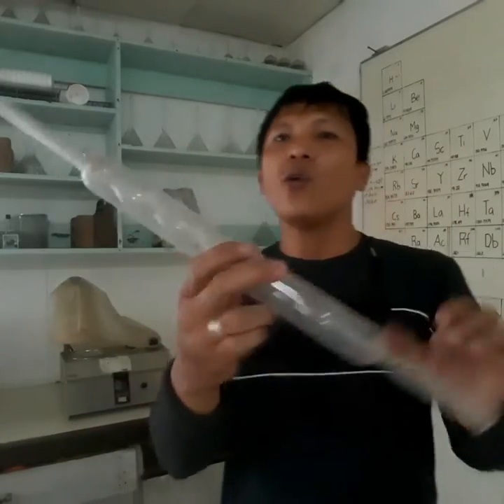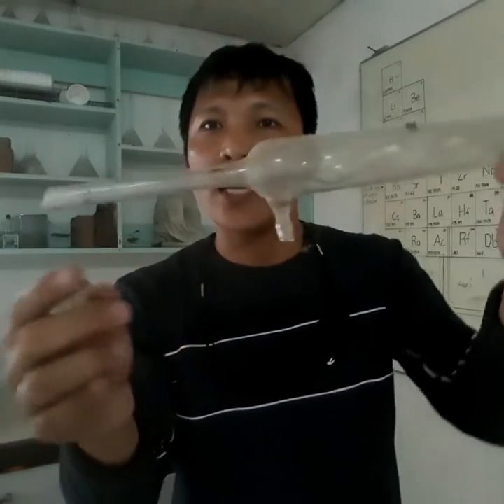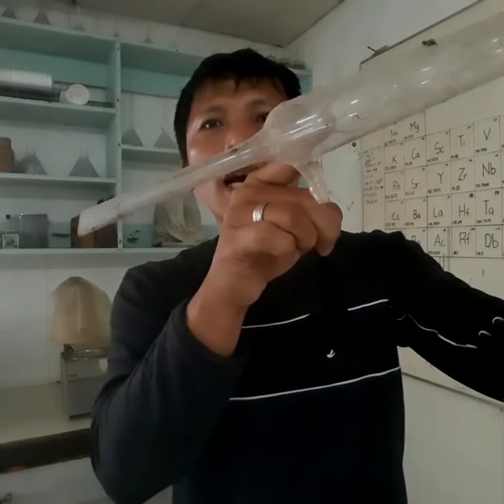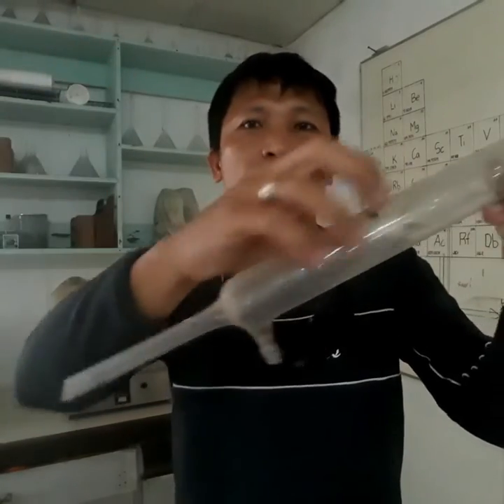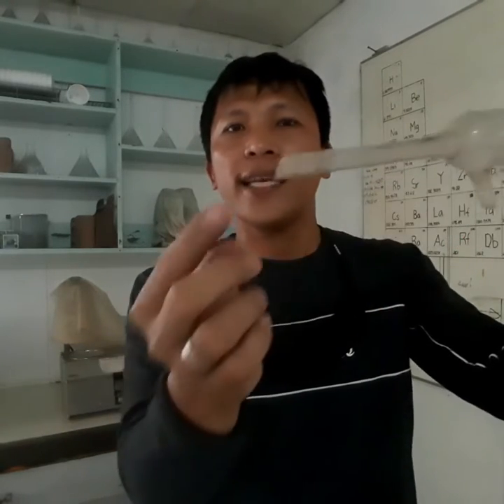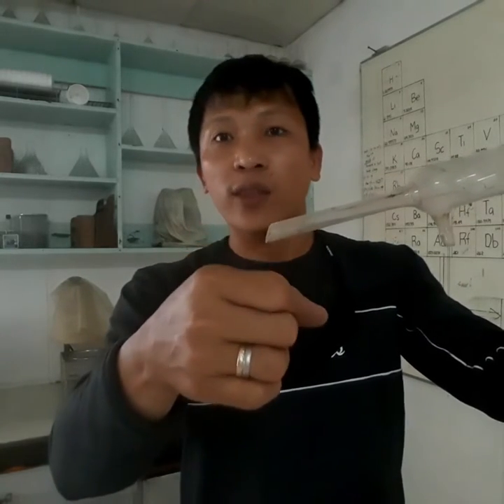And then you have a pointed tip here, usually mounted like this, so that whatever is being condensed, meaning from gas phase to liquid phase because of the cold water running inside, turns back to a liquid phase, and then it will drop from this one, and then you can put a setup here wherein it can collect those liquefied vapors.